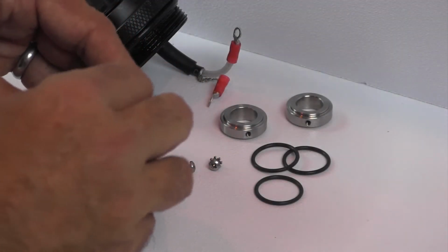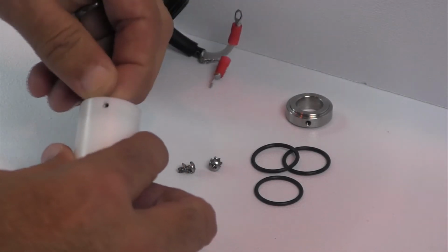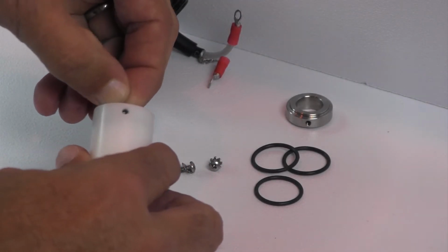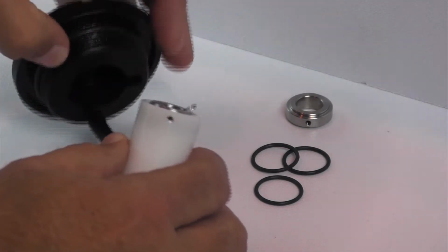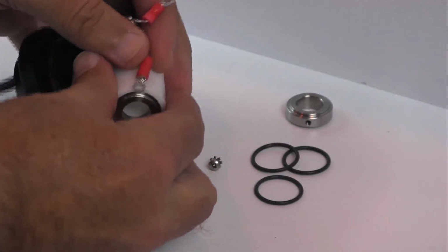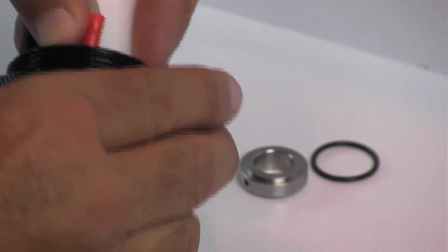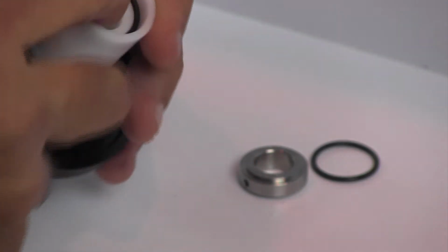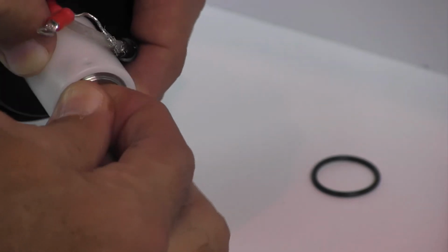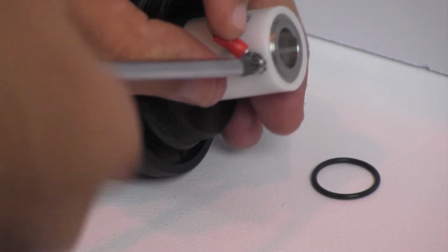Insert one of the 4 new O-rings into the new sleeve, followed by one of the electrodes, and position it such that the 2 holes line up. Connect the insulated wire to the electrode. Place an O-ring on the outside of the electrode and slide the sleeve into the sensor block bottom ring. Repeat the process for the other end of the sleeve and connect the bare wire to the second electrode.